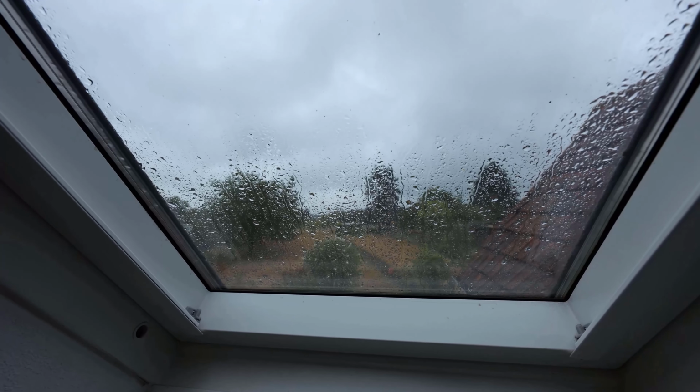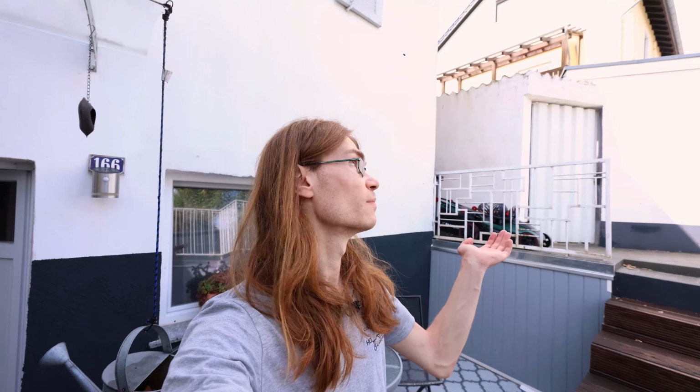God damn it. Stupid bloody weather. Yeah, that's the problem with doing chemistry outside. If it starts to rain, you're basically screwed. But the weather has improved and it's not supposed to rain. So let's quickly set up my stuff again and do the reaction, because it actually takes 12 hours and we have 1500 already, and I have no idea how I'm supposed to do this, but let's just keep going.